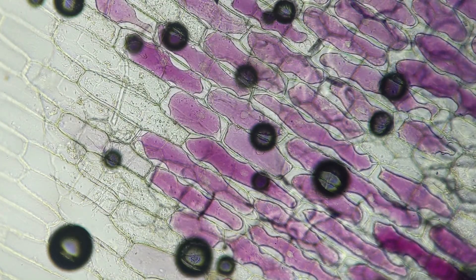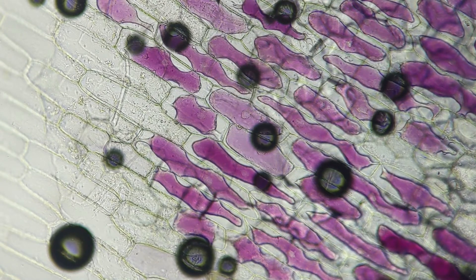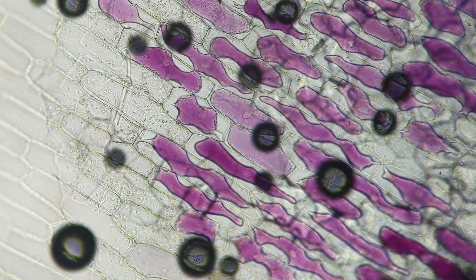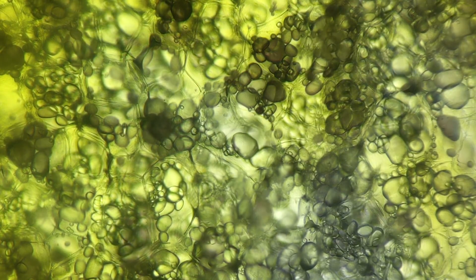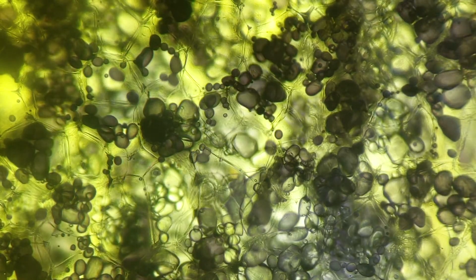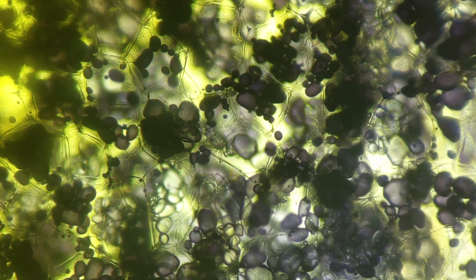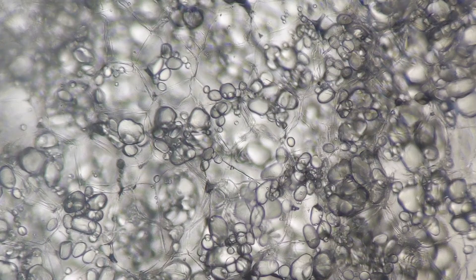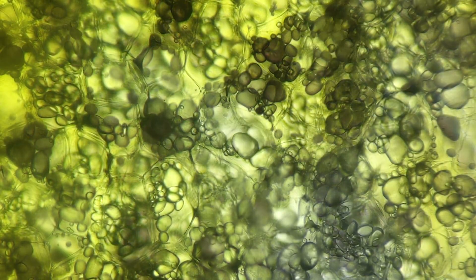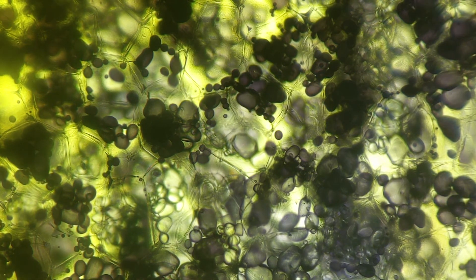Here's the same observation sped up about 500 times, so it's important to remind students to be patient — sometimes it takes two and a half or three minutes for this observation to manifest. The same can be said for the potato observation. It's really awesome to see iodine moving from high to low concentration through the potato cells and staining the starch, which helps visualize the osmotic flow. Similarly, the iodine staining of the leukoplast helps students visualize more than just osmosis — it also helps them visualize the structure and anatomy of potato cells. Well, there you have it: observations of osmosis using live plant cells.